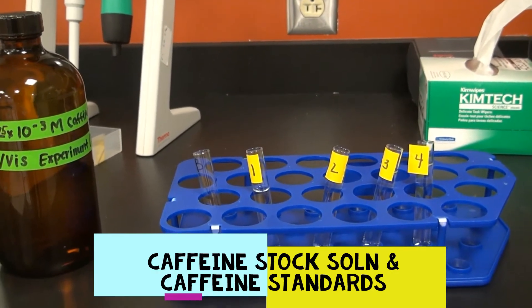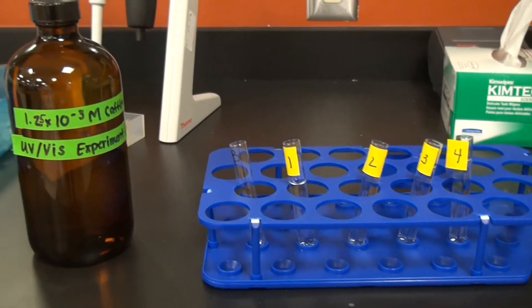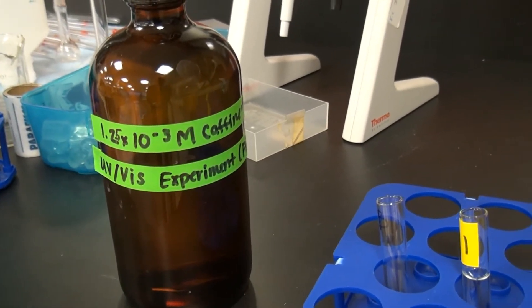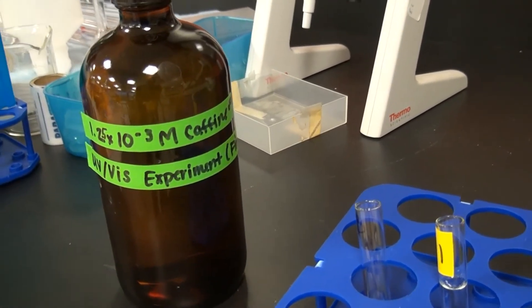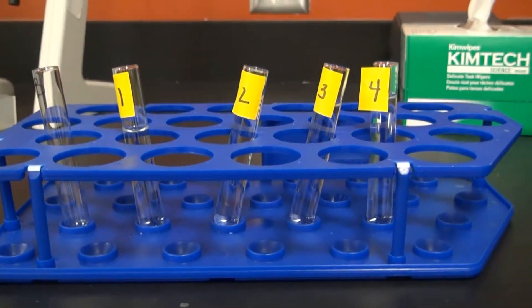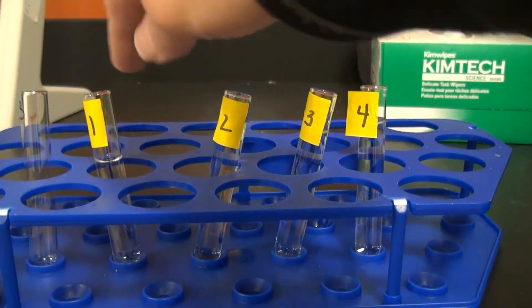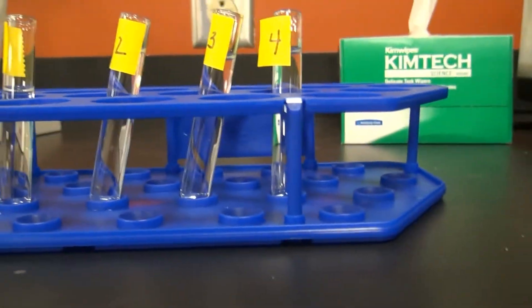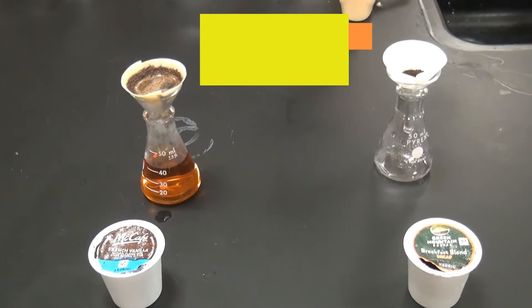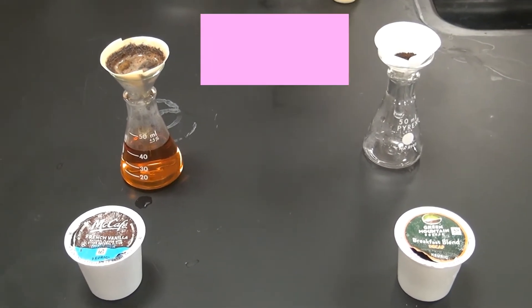For those doing in-lab, here's information to record in your notebook. The stock solution of caffeine is 1.25×10⁻³ molar. The standard solutions are already made and poured into cuvettes to be measured. The first cuvette is B — the blank, just water — and then solutions one, two, three, and four. You can see they're all pretty clear solutions with just the caffeine molecule in them.